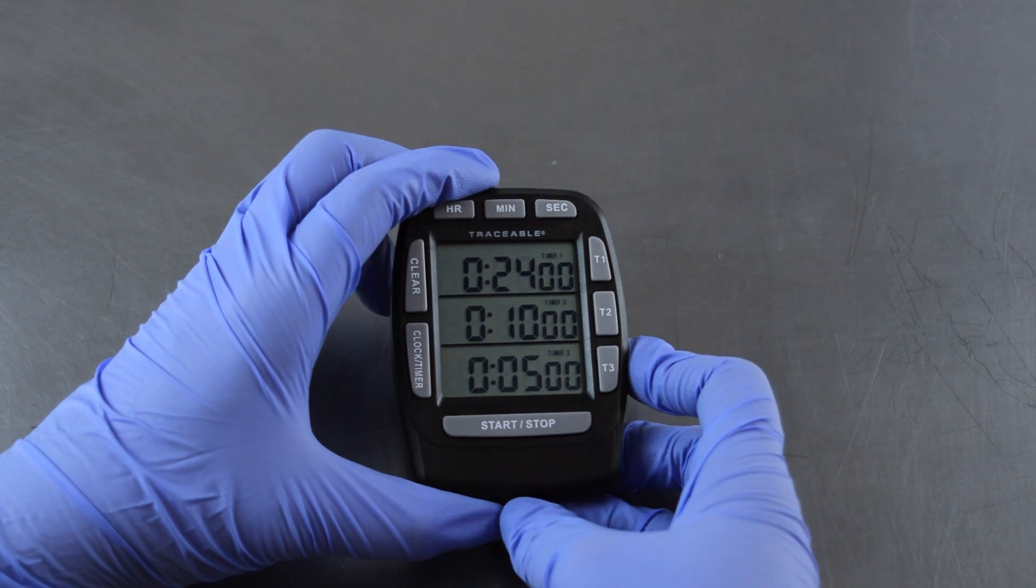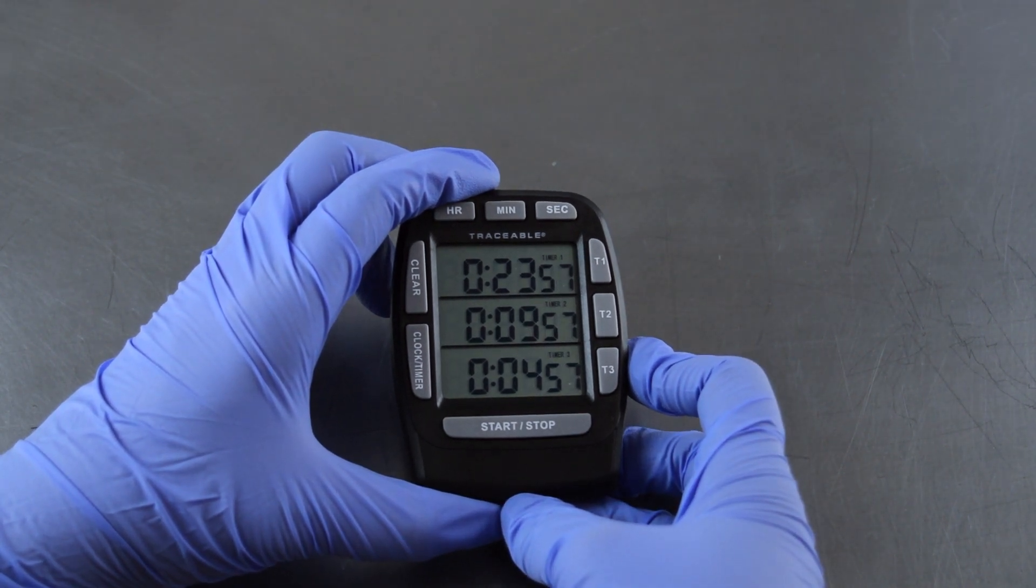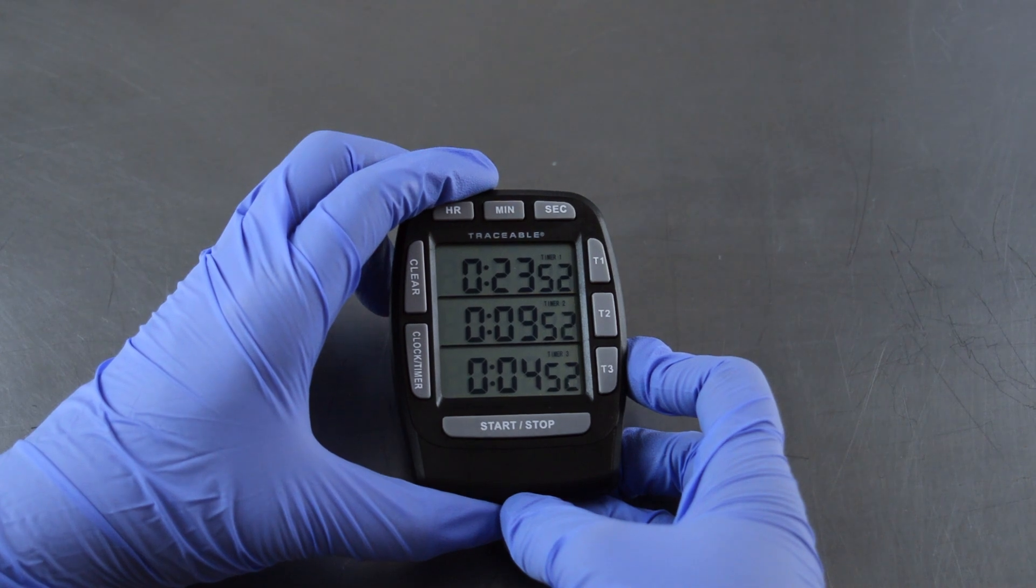When you're ready to start taking your sample, simply press the large button that reads start/stop. You will see all three clocks counting down.